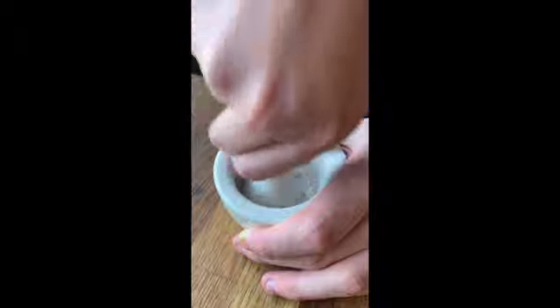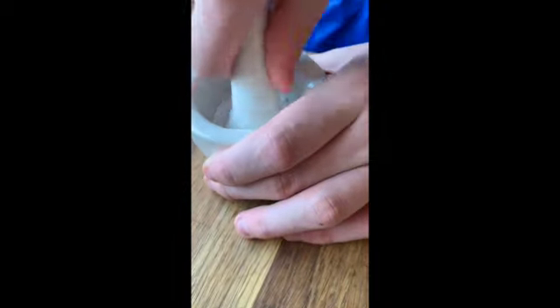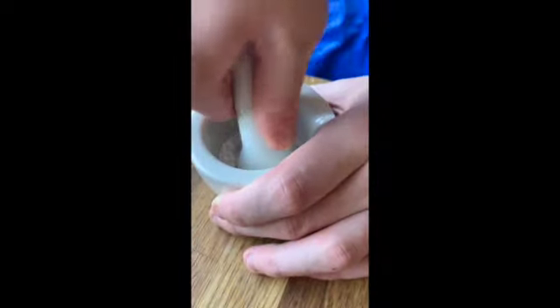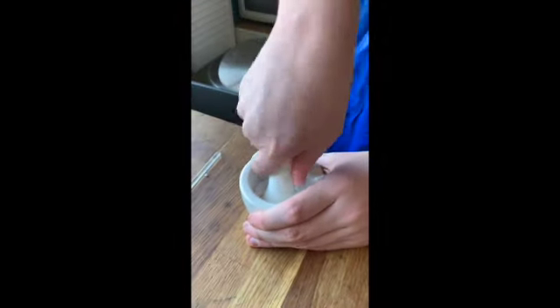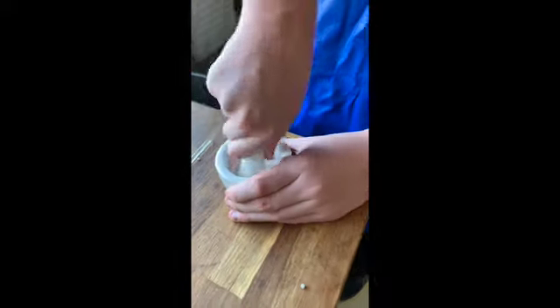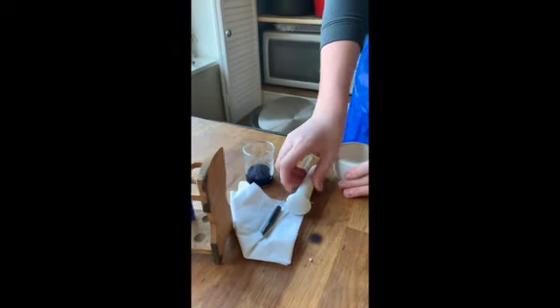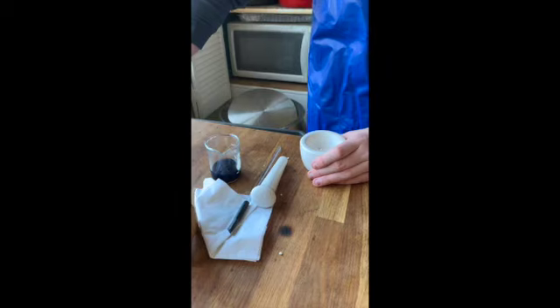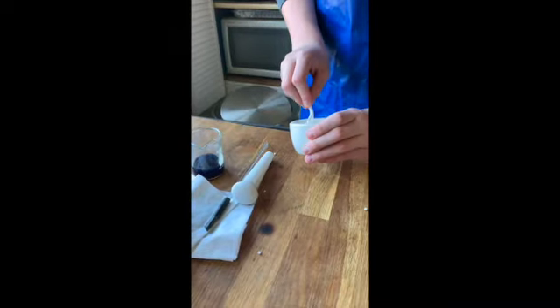He's crushing that up first because we want it to be in a nice fine powder — using a mortar and pestle to turn it more into a powder. He's going to put a little spoonful of that into one of our test tubes. By adding calcium chloride, what we're doing is we're adding chloride ions. So that is our stress — we are adding the chloride ion.